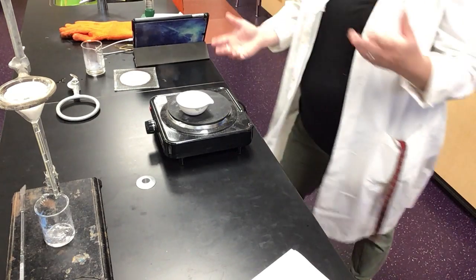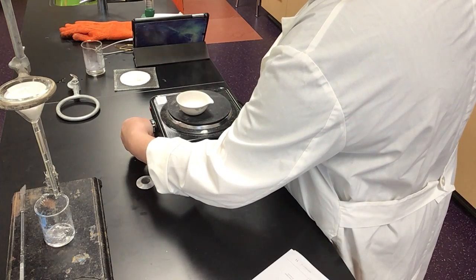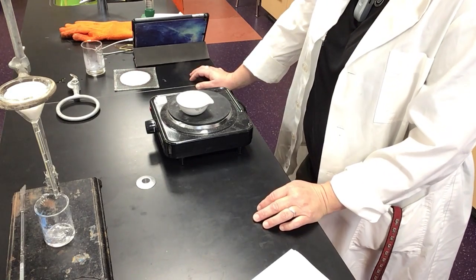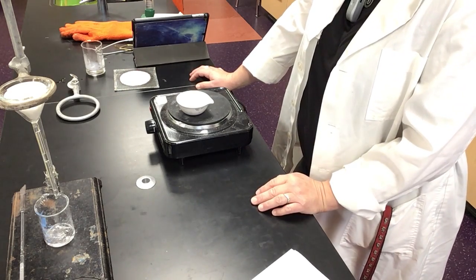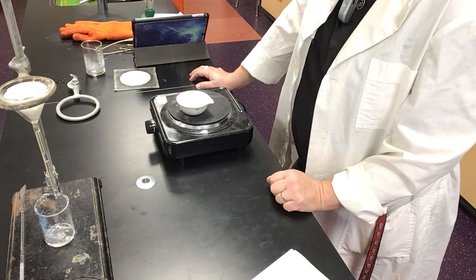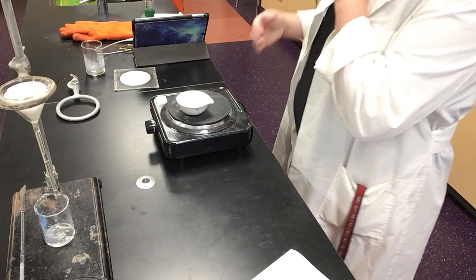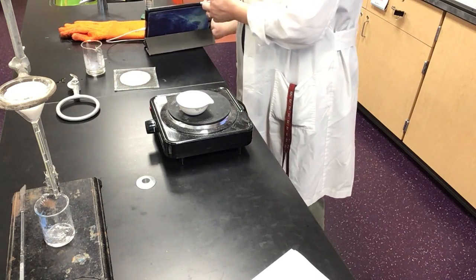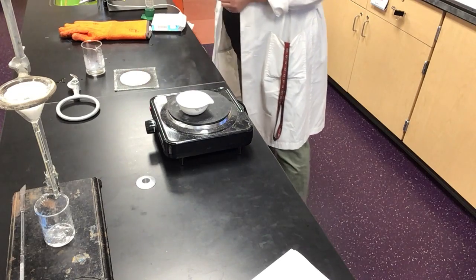Okay, so with that, having demonstrated totally, oh, there's a big fat chunk. I'm going to turn that down a little bit because I'm getting lots and lots of spatter. You might actually even be able to see that on the video. Oh, there's a nice big fat chunk that just came popping out. Again, this is doing everything wrong. Once you've gotten it to a point where it is so overheated that you're seeing spatter, it's really hard to tame. So I turned this down to low.